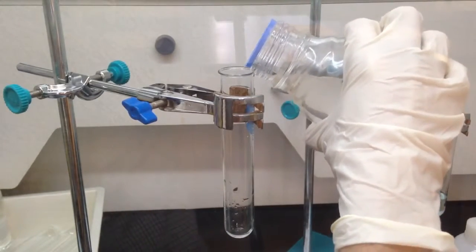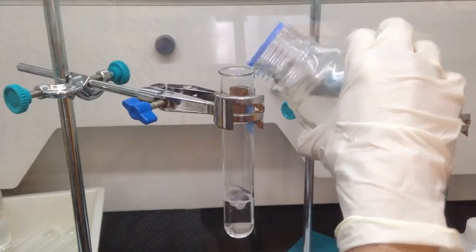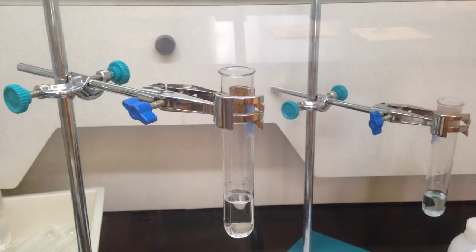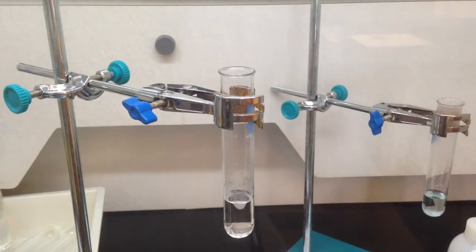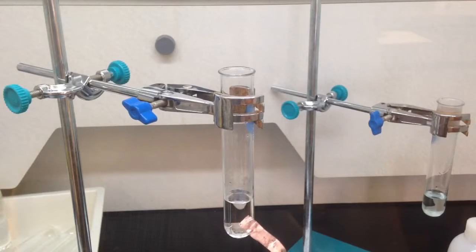Okay, the color of concentrated nitric acid is simply colorless. And this time we have copper metal. As we have learned in the topic of acid and alkali, copper cannot react with acids. Most acids cannot react with copper, except nitric acid. This time we have concentrated nitric acid, and let's see what would happen.